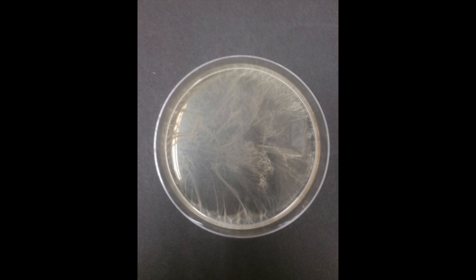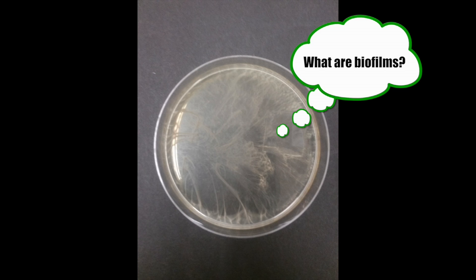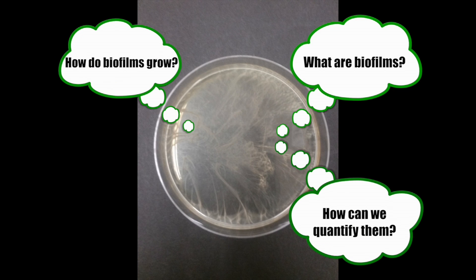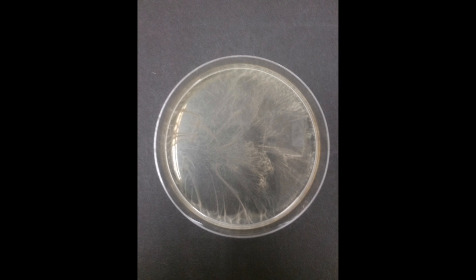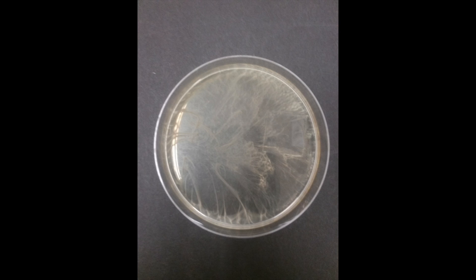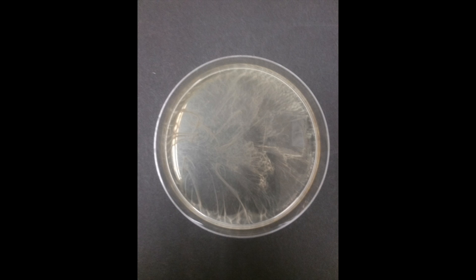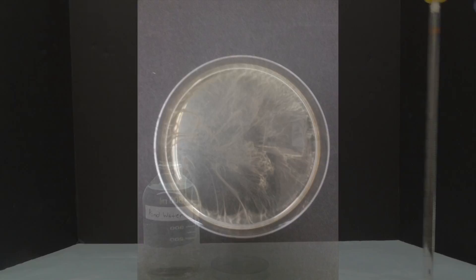This experiment makes an effort to learn what biofilms are, how they grow, and how we can quantify their growth over a period of time. We are able to answer these questions based on the relationship of the extracellular polymeric substance that biofilms are made of binding to a dye called crystal violet.